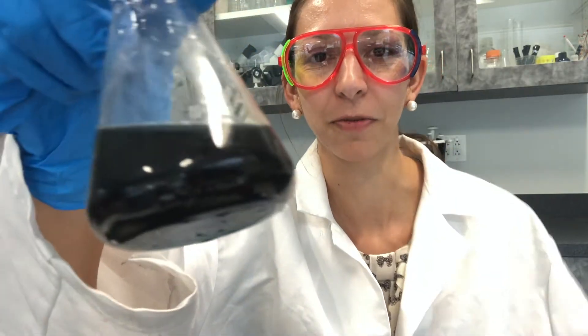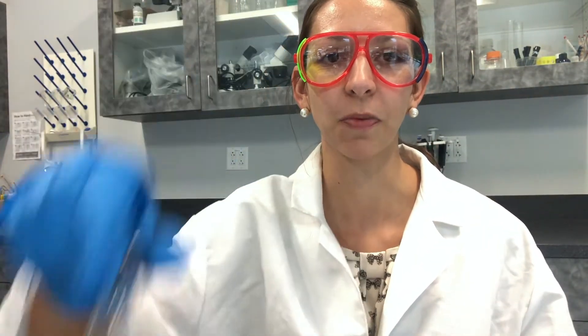Here it is in my little Erlenmeyer flask. Bromothymol blue, or BTB, is a chemical indicator, meaning it changes colors in the presence of different pHs. In basic solutions, or solutions above a pH of 7.6, it's going to be bluish. In acidic solutions it's going to be yellow. In more neutral solutions it's going to be more green. So you can see here we have sort of a green-bluish color to get started with.